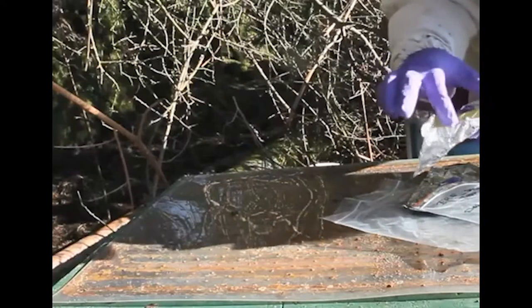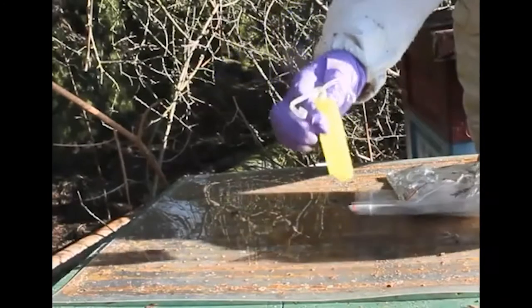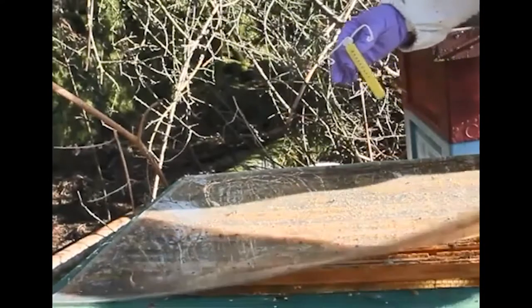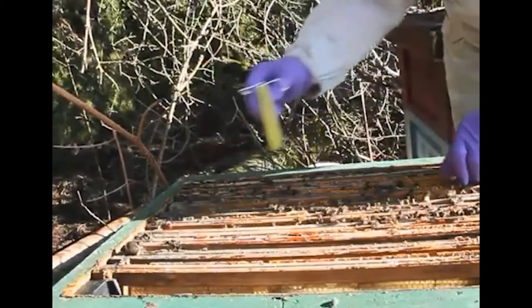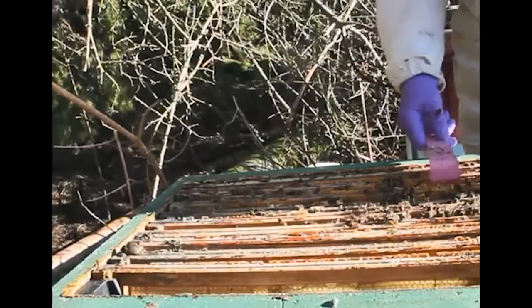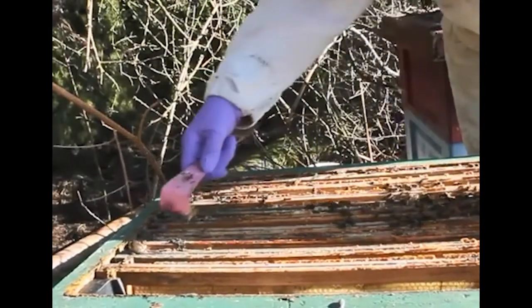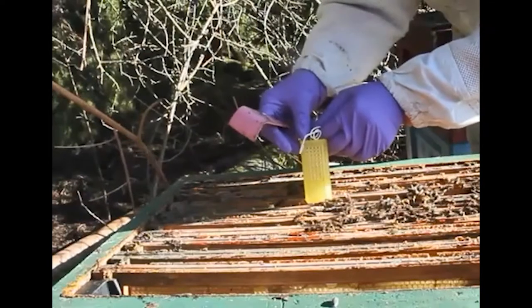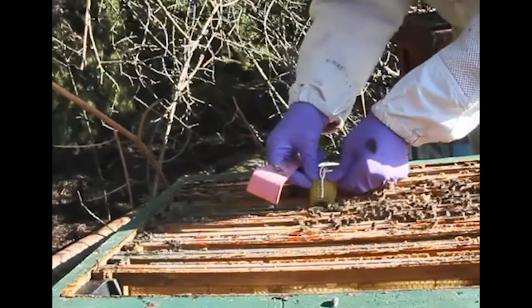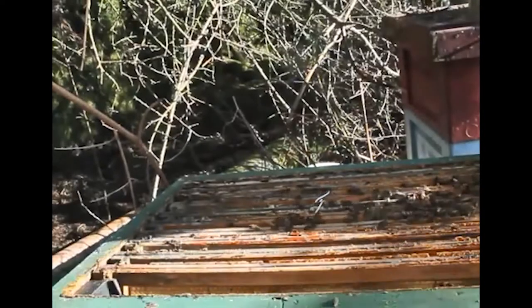According to the instructions, the sampler is actually inside a queen cage - nicely done - and there are hooks on it so the hooks will clip down over the top of the frames. I've just removed the crown board and you can see the frames are fairly well stuck together. There are quite a number of bees on those frames at the back of the brood box, and the sampler, once a small bit of space is made, will actually slide down between the frames and clip over the adjoining frames.